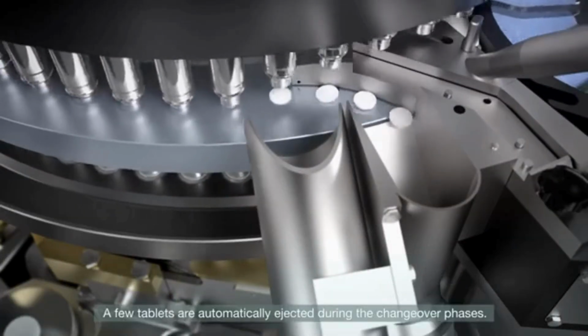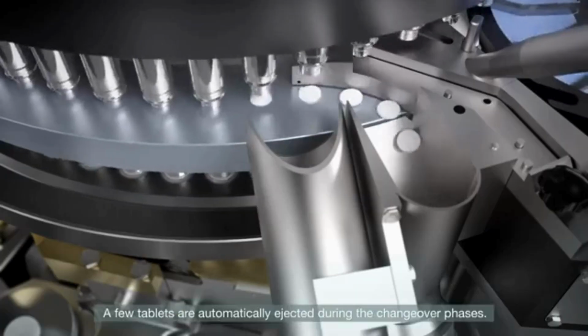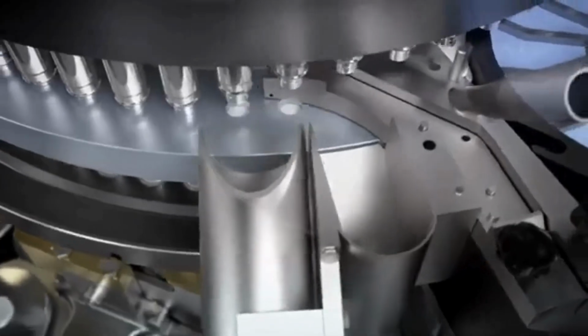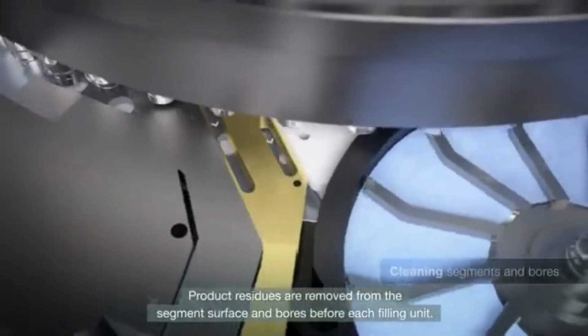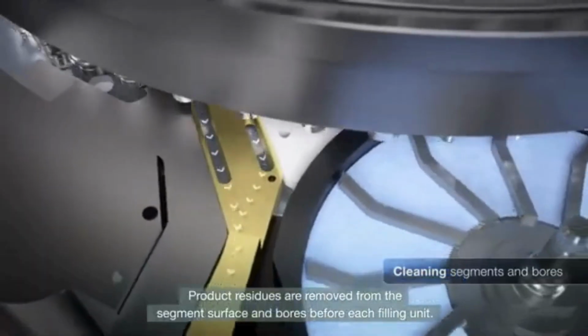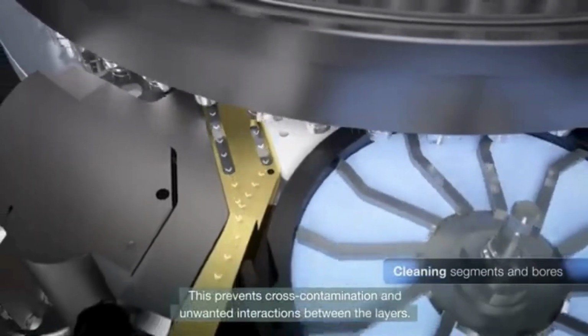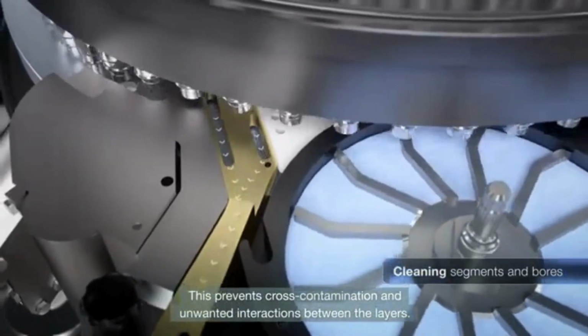A few tablets are automatically ejected during the changeover phases. Product residues are removed from the segment surface and bores before each filling unit. This prevents cross-contamination and unwanted interactions between the layers.